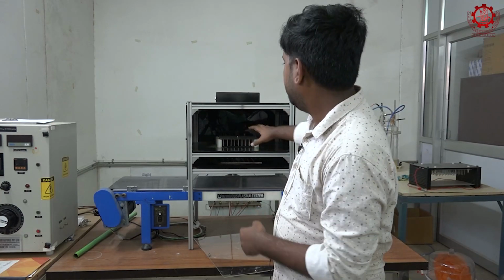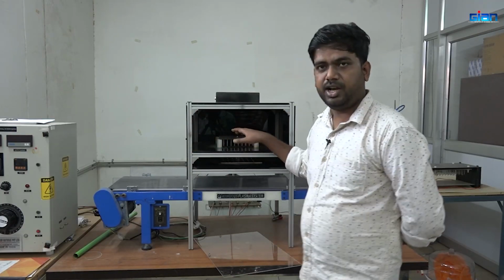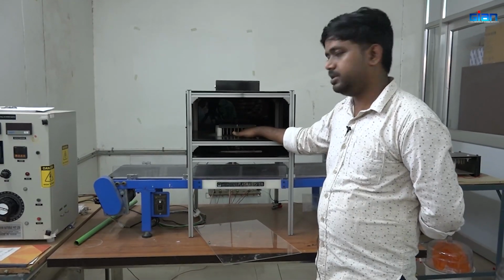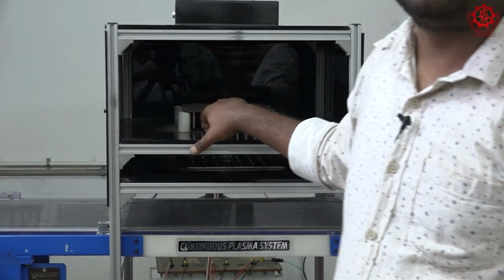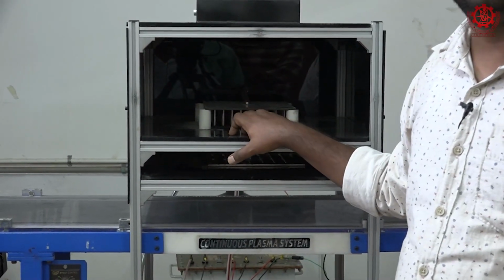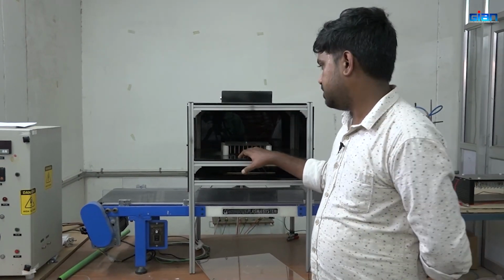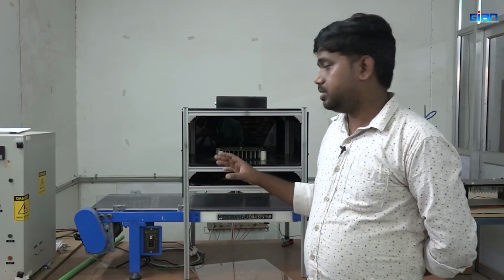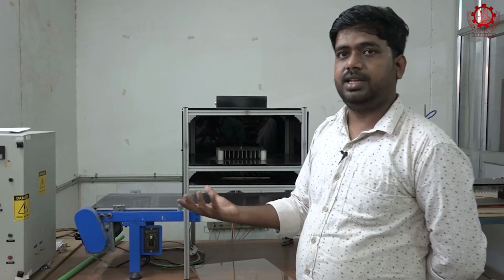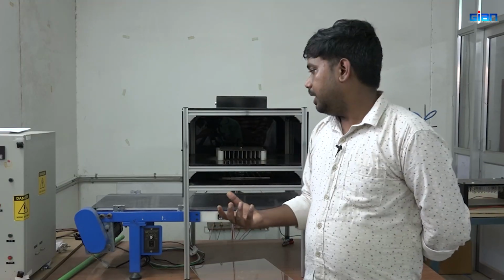So if you can see, when we apply the high electric voltage, whatever air is there will first be ionized and converted into reactive species. The oxygen and other atmospheric air components will be converted into reactive oxygen species, nitrogen species, hydrogen peroxide and other reactive substances. These simultaneously go down to the surface, but the limitation is that due to this bombardment, it is more effective at the upper layer of the sample. So we recommend the sample thickness should not be high, so that we can get better effectiveness.